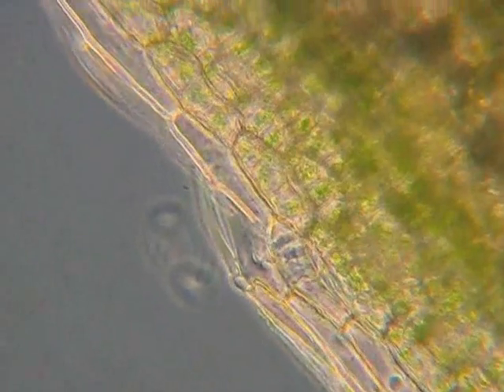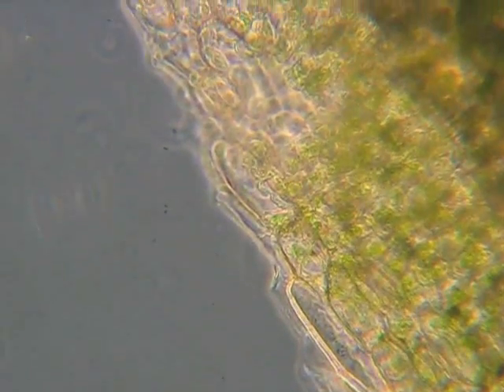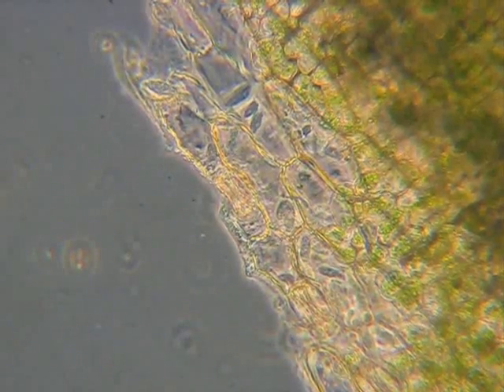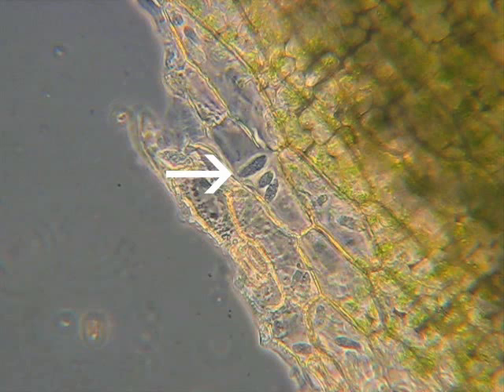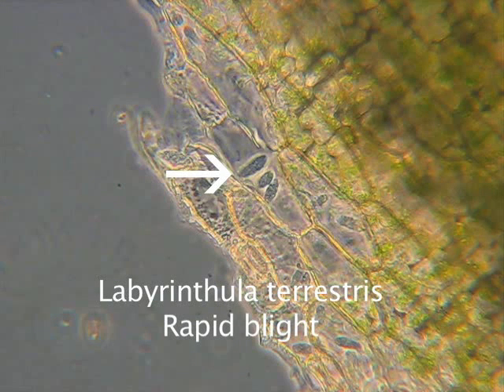We're looking at just a single-cell depth and keep scanning up. It takes a little time to look around enough to be sure you're seeing the organism inside the tissues — to get good confirmation that it's actually inside and not just outside. There we can see some cells right inside the plant tissues, and that's pretty much what you need to confirm the diagnosis as rapid blight caused by Labyrinthula terrestris.